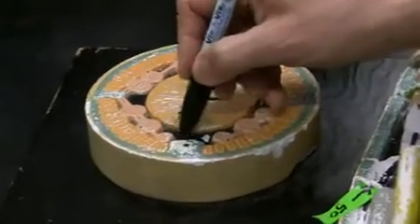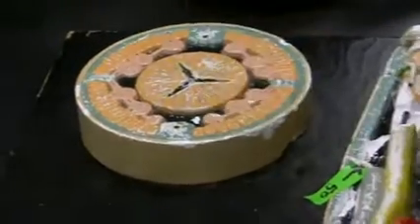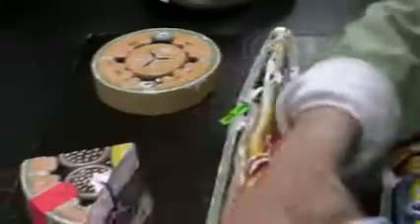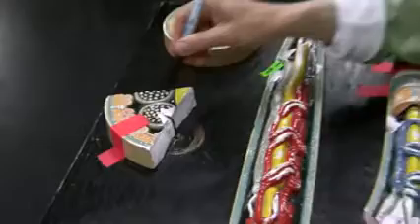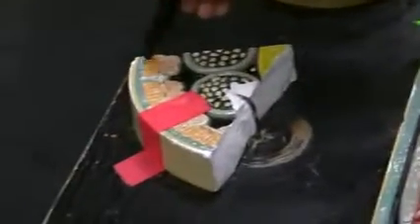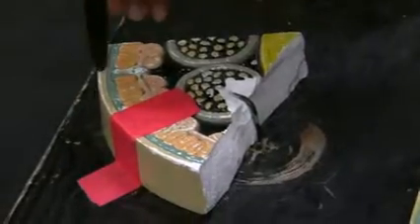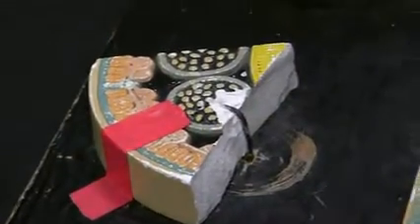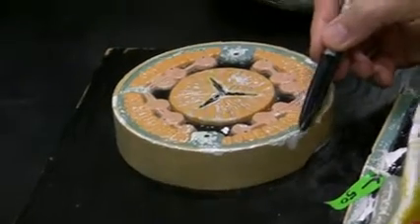Pseudocoelom, sorry. Pseudocoelom area. Okay, this is a cross section from right in this. That was a cross section from this area. This is a cross section from that area. Uterus, intestine, longitudinal muscles, nerve cord, and right here these are cuticle.